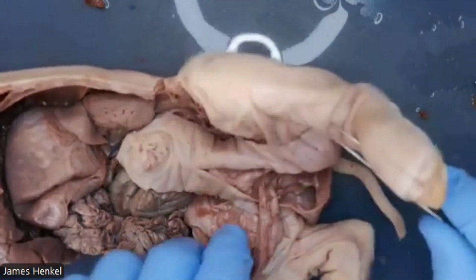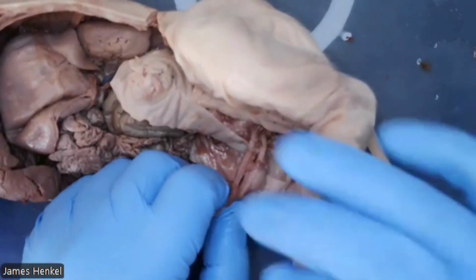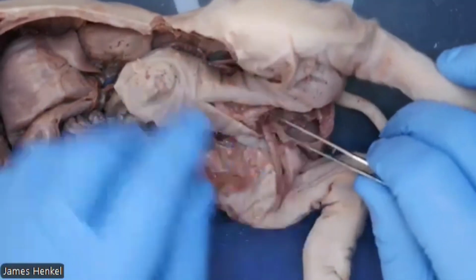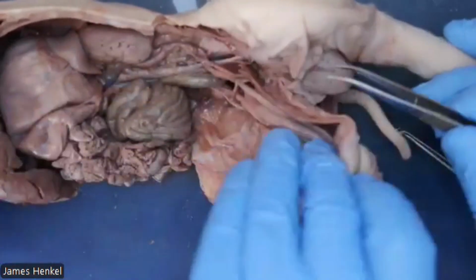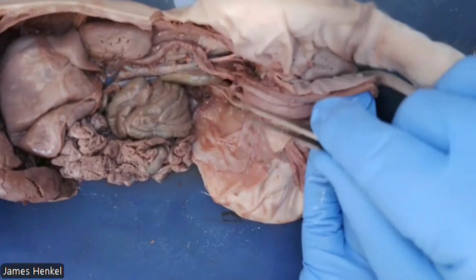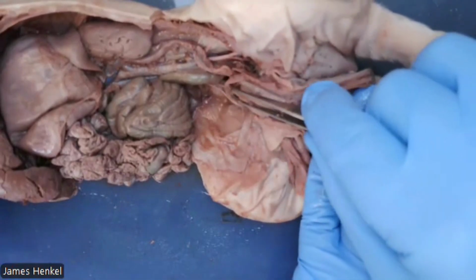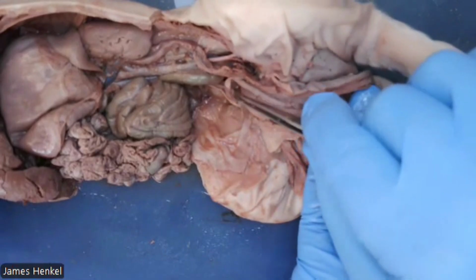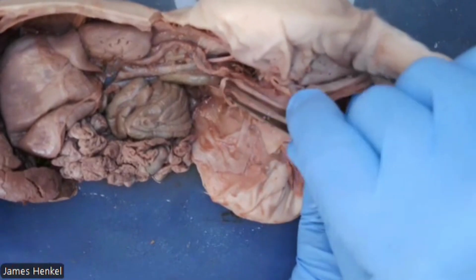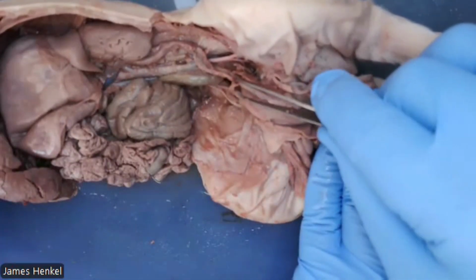And this tube that comes from this is the vas deferens, but it goes all the way down and underneath and joins together on the other side of the bladder that we can see in the peritoneal cavity. So that's shown right here. And one tube comes from one side, and the other tube comes from the other side, and then it links in the middle and makes that little loop that you can see there. And that loop is connected underneath to the urethra, which is quite a bit smaller in this case, to see where it connects to the spermatic cord.